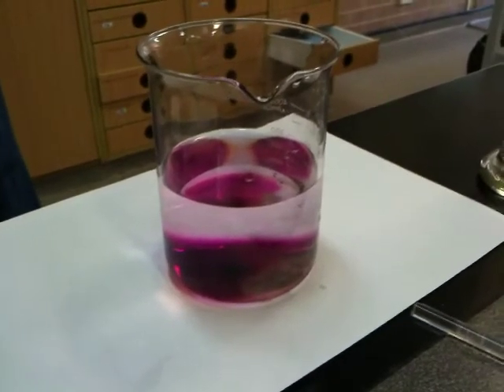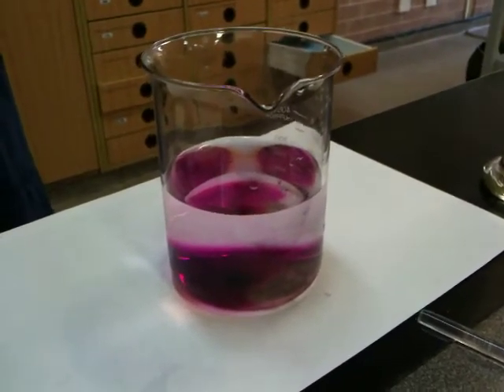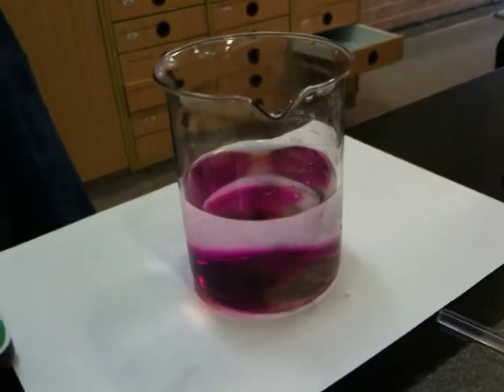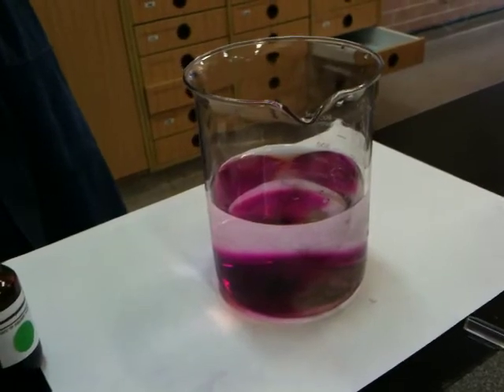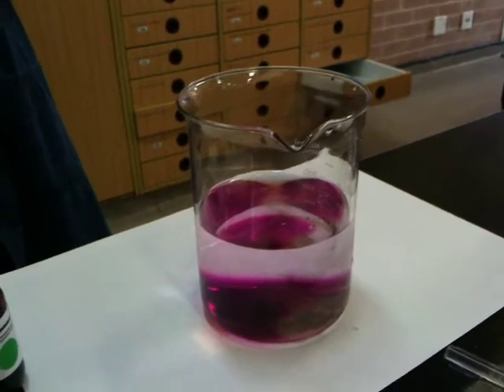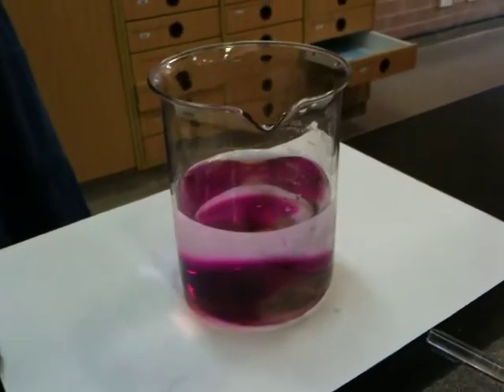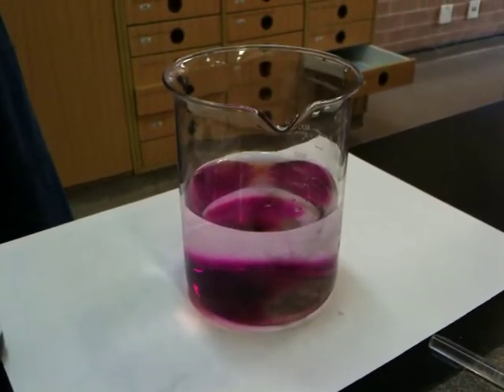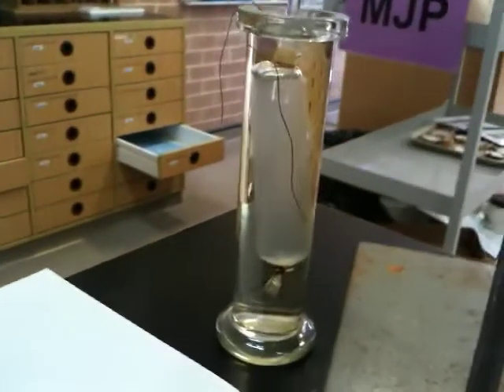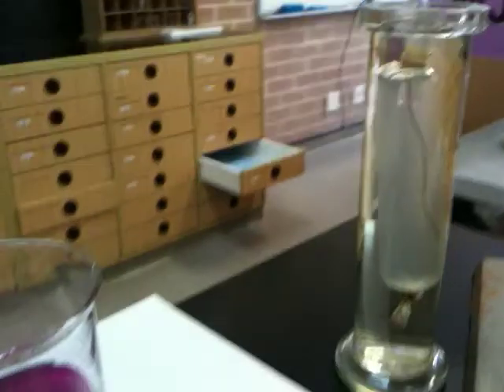And so what are we trying to show here? Diffusion. Excellent. And so what do you understand diffusion as? The solute is the substance being dissolved, and the solvent is the substance in which the solute dissolves. The spreading of molecules of any substance from regions of high concentration to regions of low concentration is known as diffusion. Excellent. Okay, cool. So we'll have a look in about 10 more minutes whether this starch inside that bag has turned blue-black. Thanks for that.